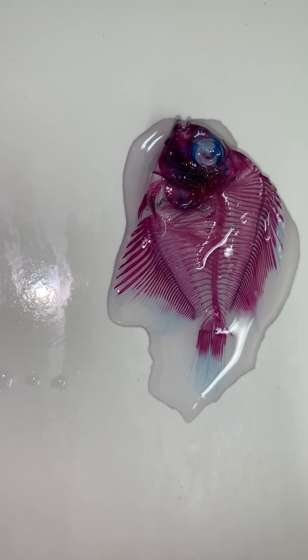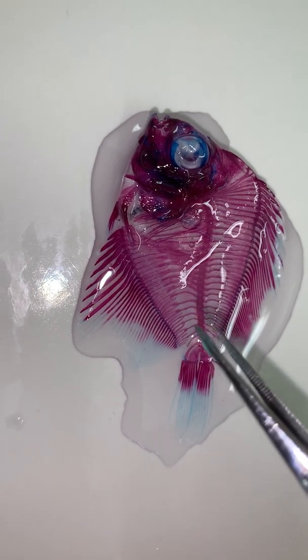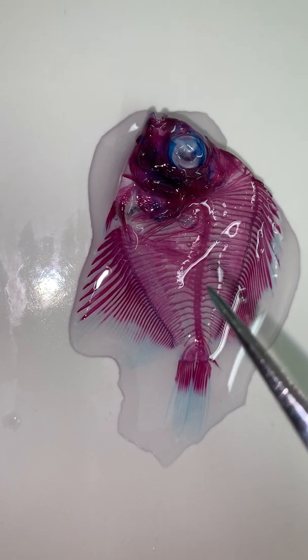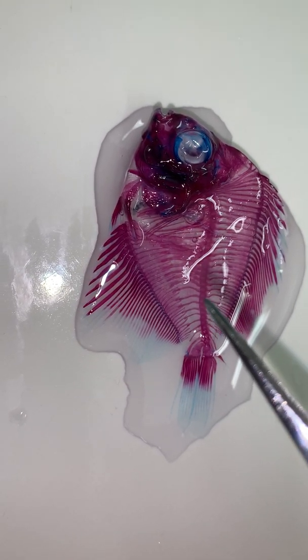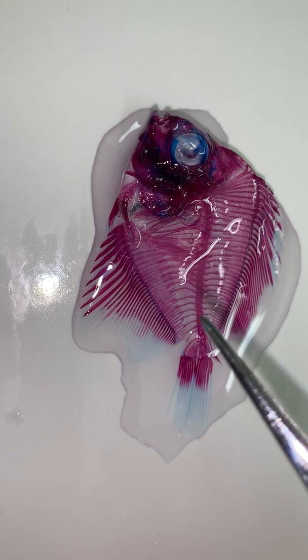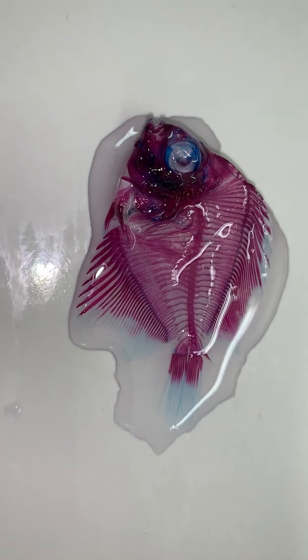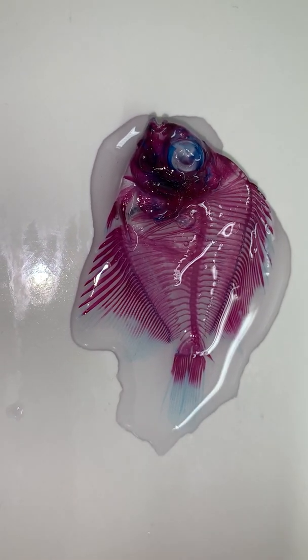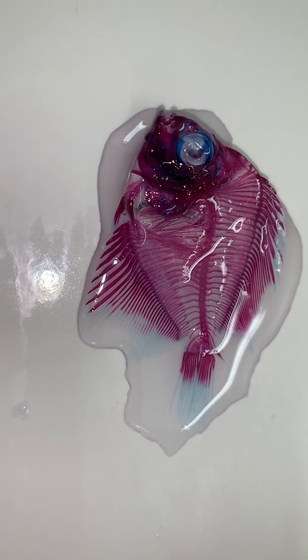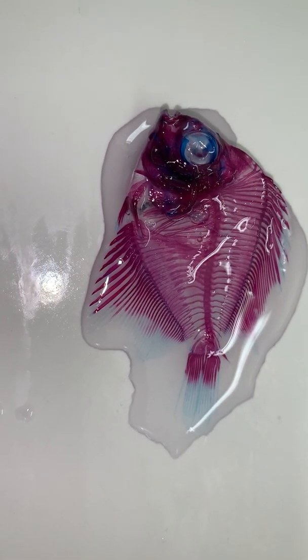All right, and what you'll also notice is that different from the cat, the vertebrae here are all red, and that's because their vertebrae form in a different way than our vertebrae. So when they form, their notochord does ossify partially endochondrally, but most of what is on the outside here is bone that has formed intramembranously. So we see the complete vertebra already because that little bit of cartilage is already converted to bone, and we see that most of the rest of the vertebrae are intramembranous because there is no cartilage between the successive vertebrae.